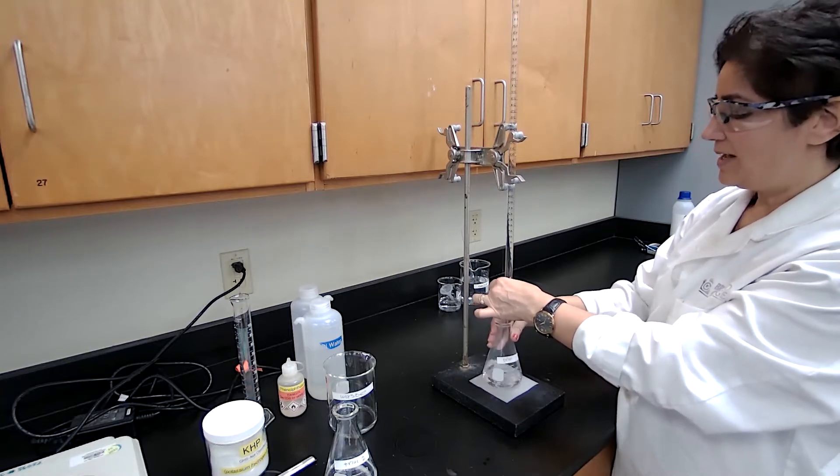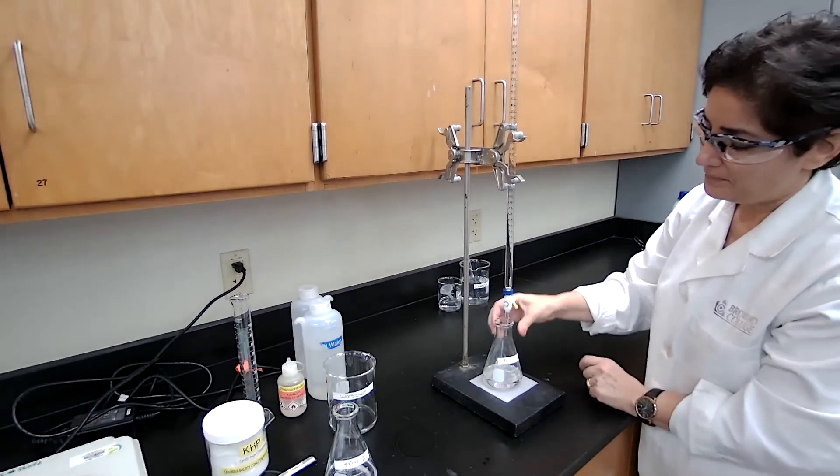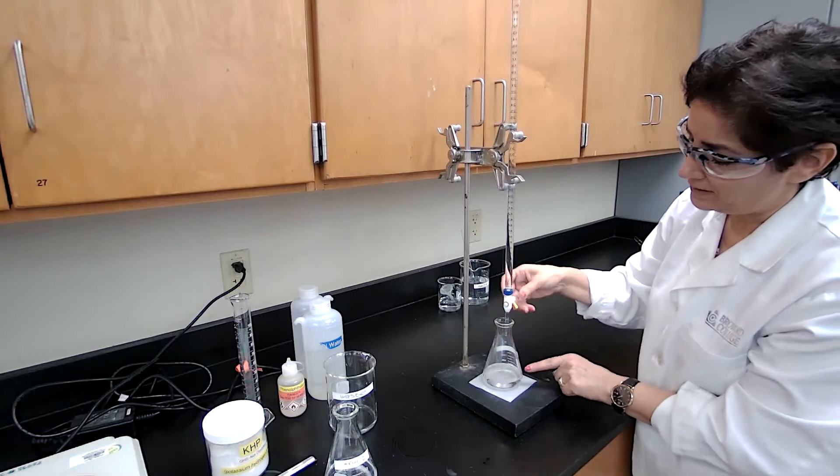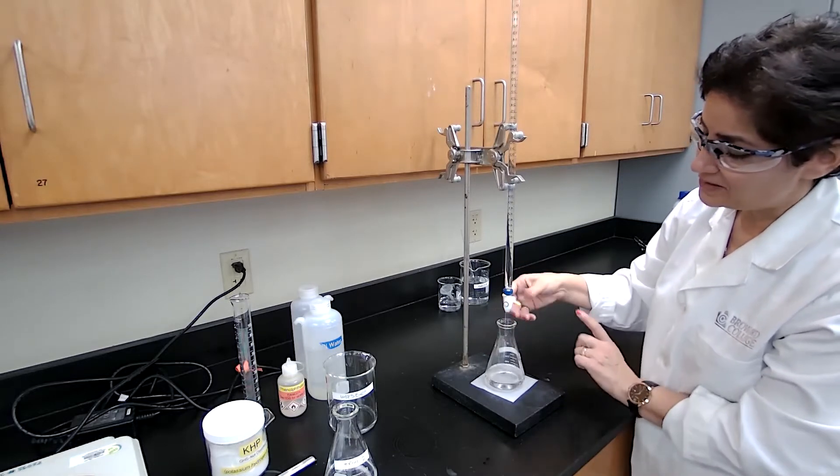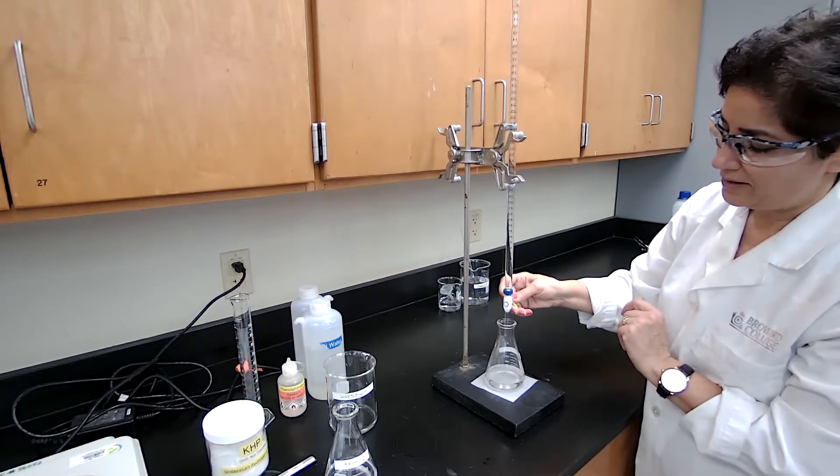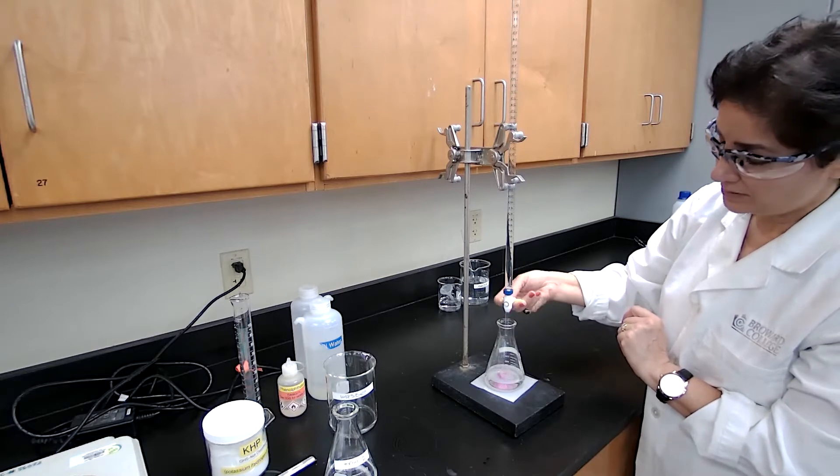So at the beginning, I can add fast, but when the pink color appears and disappears—if it disappears fast, that means it's still too far from the endpoint of the reaction or equivalence point.